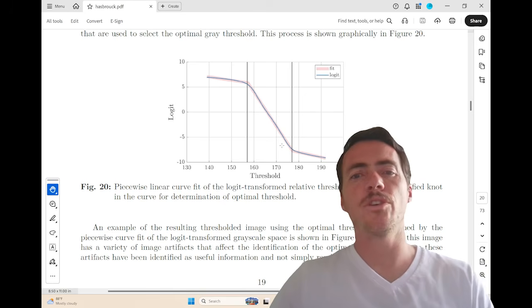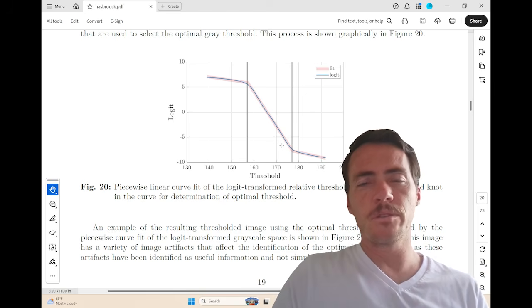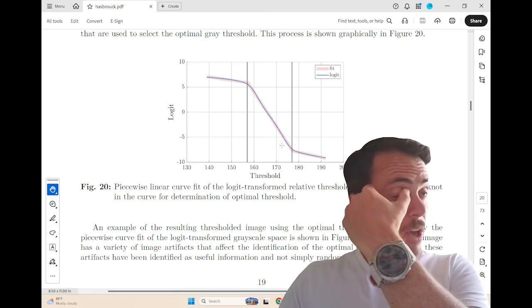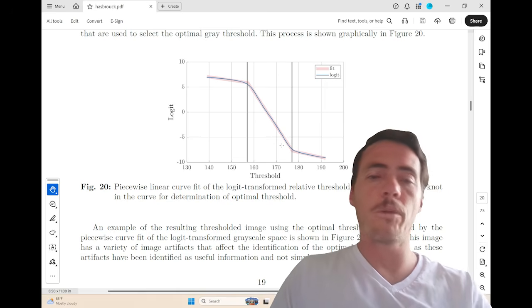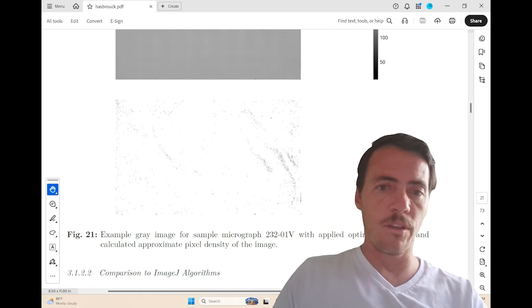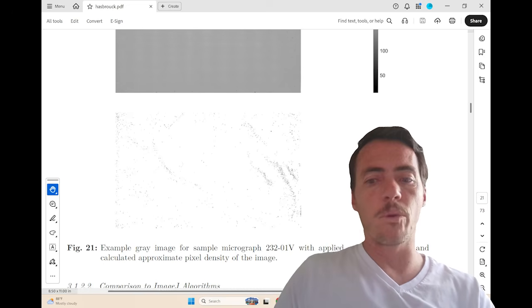Maybe one more thing to show you is this really cool thing. The classifiers are great, but the thresholding technique might be the thing that people will build off of this work to actually use. It's pretty clever. What value do you use to identify where pores start to show up? If you look at these images, right, as you adjust the thresholding, you'll see that different points will emerge. So is that background noise or is that pores?